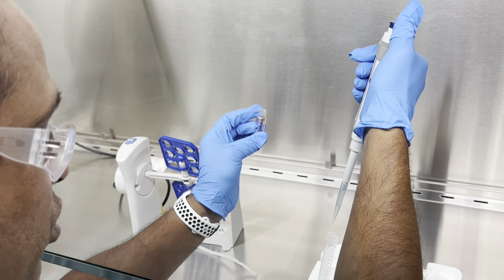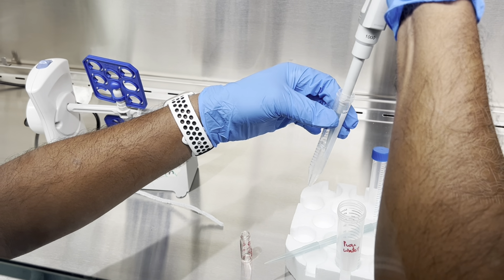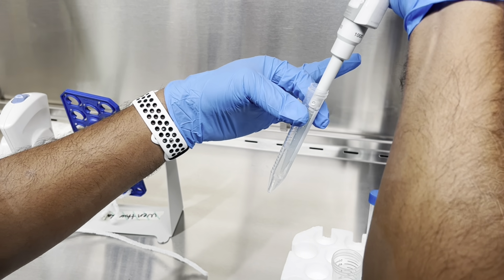So that is 400. Yeah, you go back and forth a little bit. Right? Yeah.